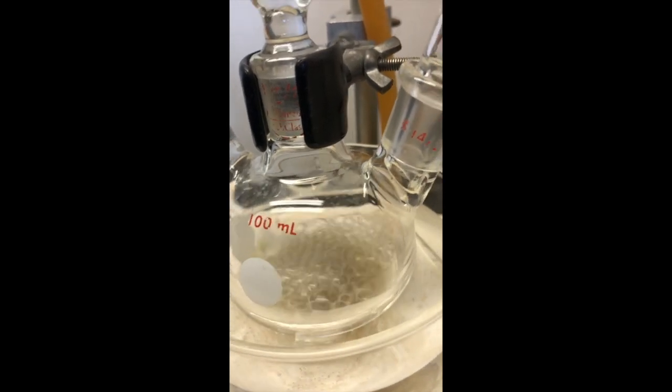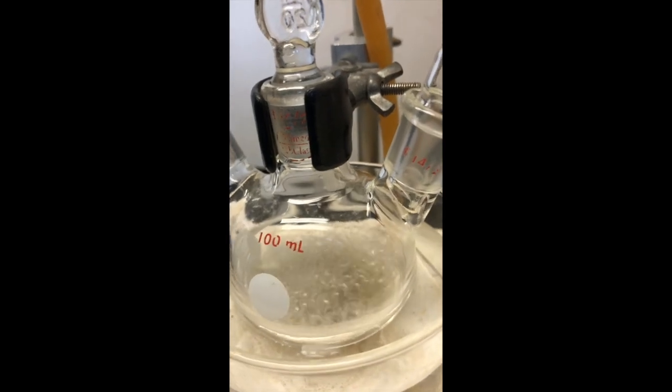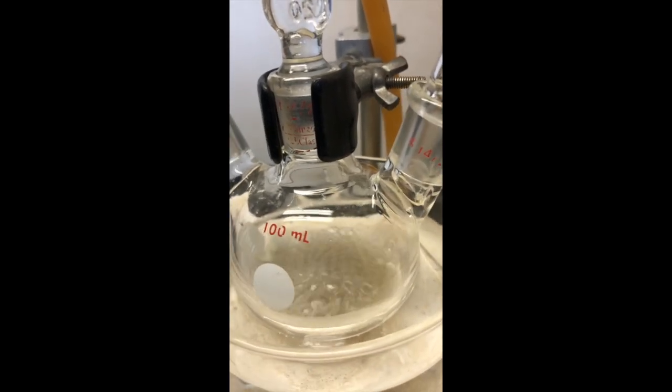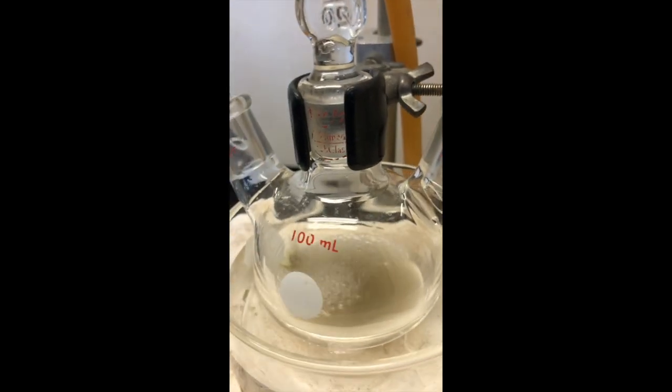Notice the boiling increased rapidly on addition of the acetophenone. That reaction is quite exothermic. Something is reacting. So it's all been added in there.